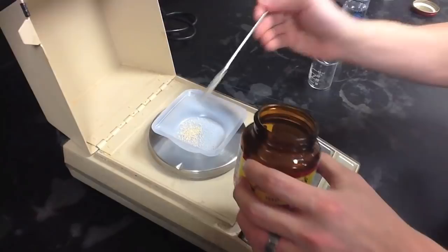Once we've successfully measured out the appropriate amount, we then transfer the yeast to a beaker so that we can mix it with the appropriate solution.